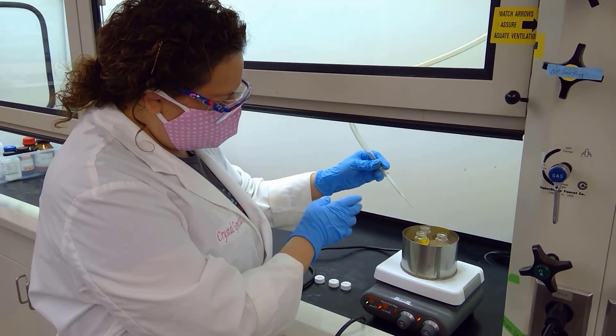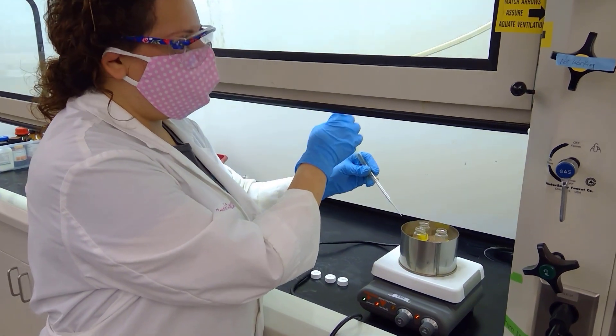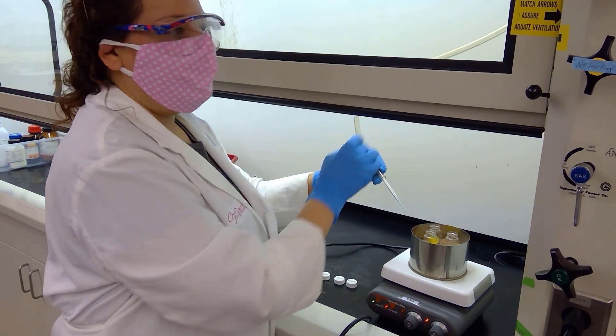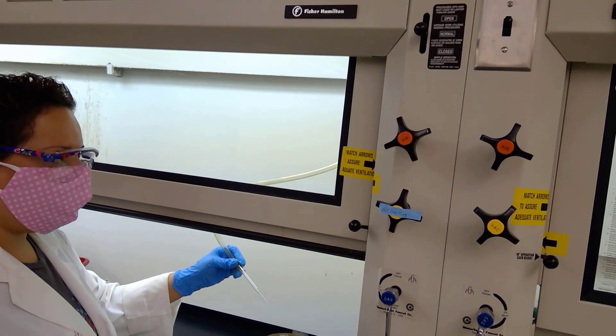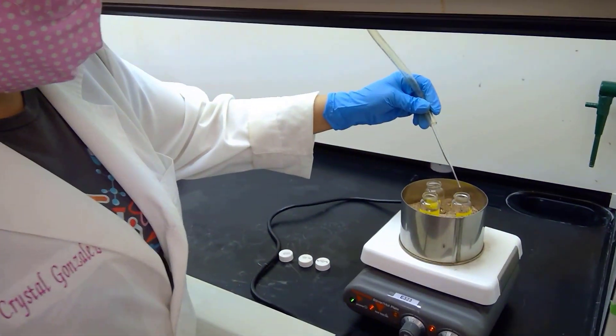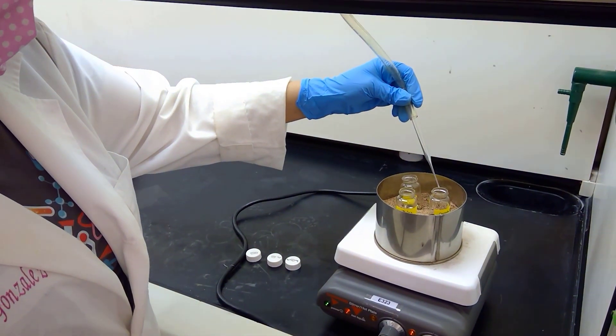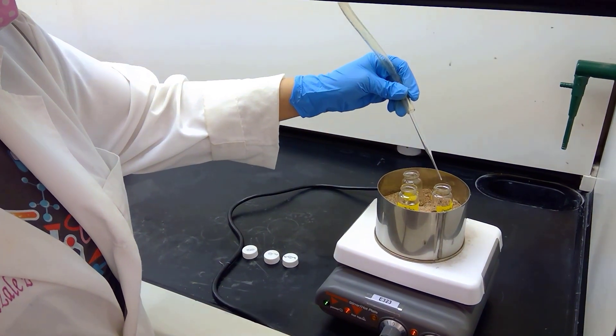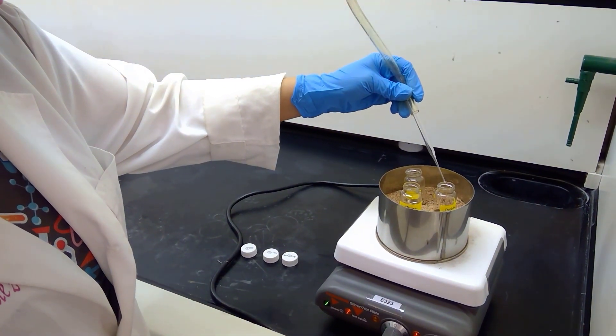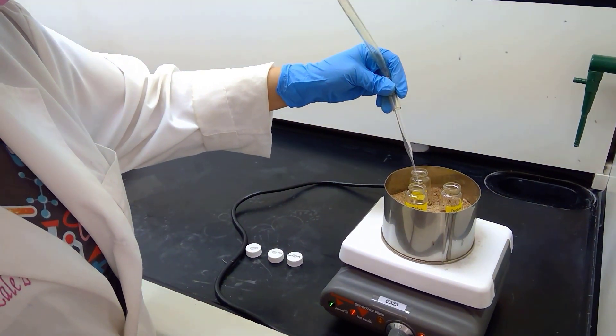What I have here in my hand is a pipette that's connected to a tube and it's connected to our air nozzle. So I'm going to go ahead and blow a little air over the samples here just to help them evaporate a little quicker as they are boiling, and that way we are able to evaporate away all of the ethyl acetate solvent that is in there.